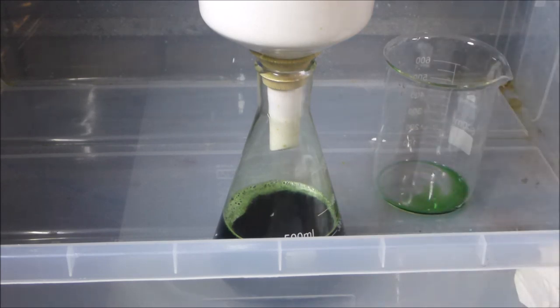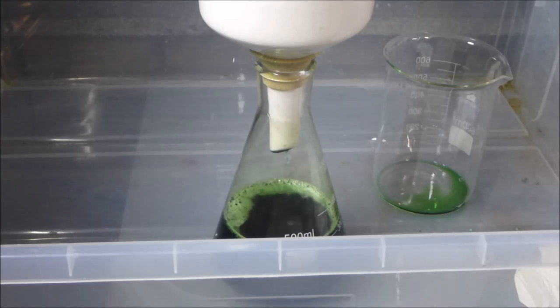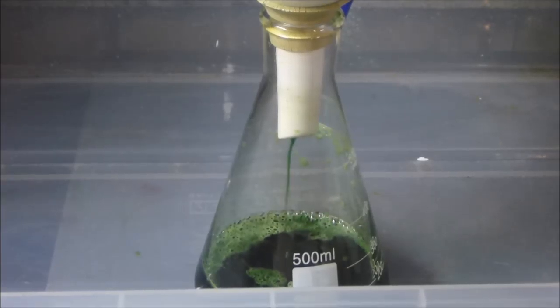So I'll just turn on the vacuum again to give you guys an idea of what the flow looks like now. So there's still a steady stream coming out like that. We just let it settle. Yeah, so it looks about like that at the moment. So still going relatively fast, fairly unbelievably fast actually.